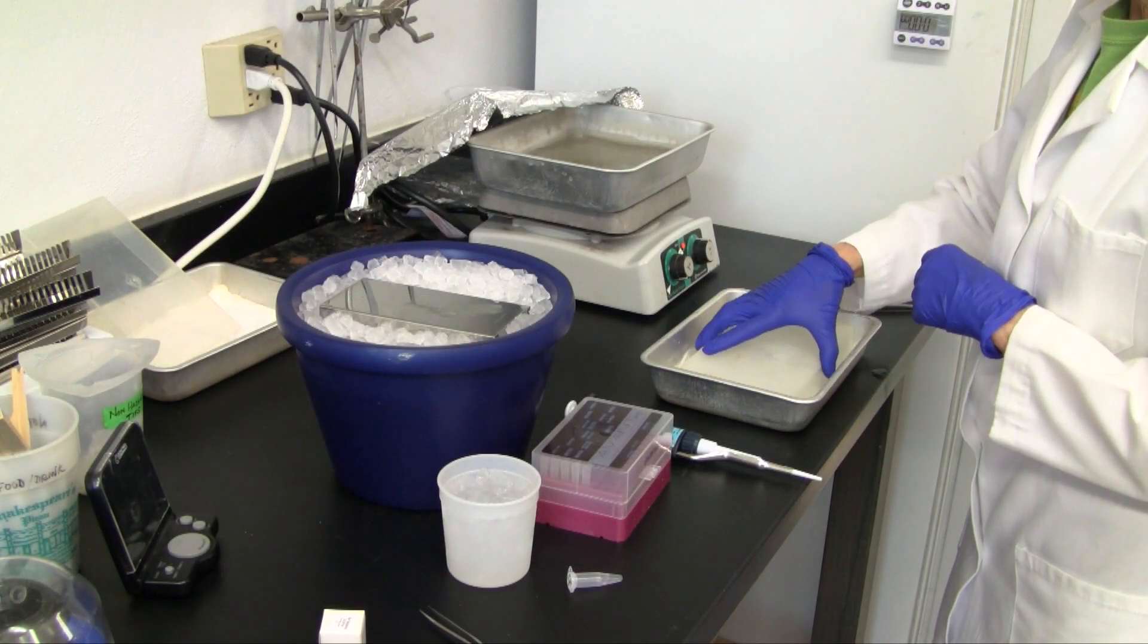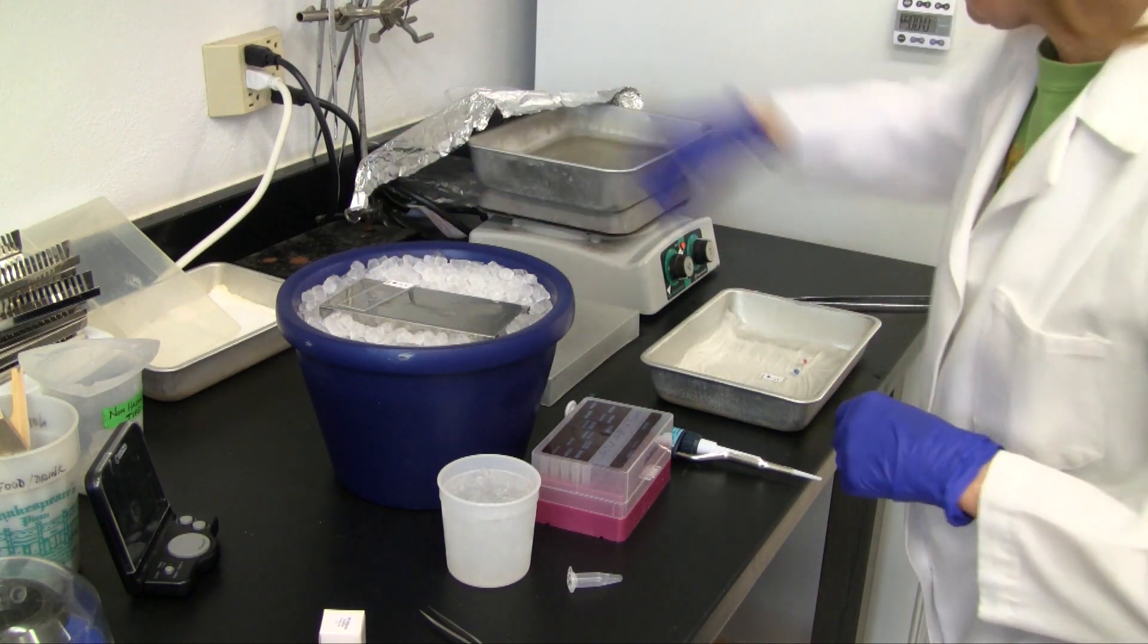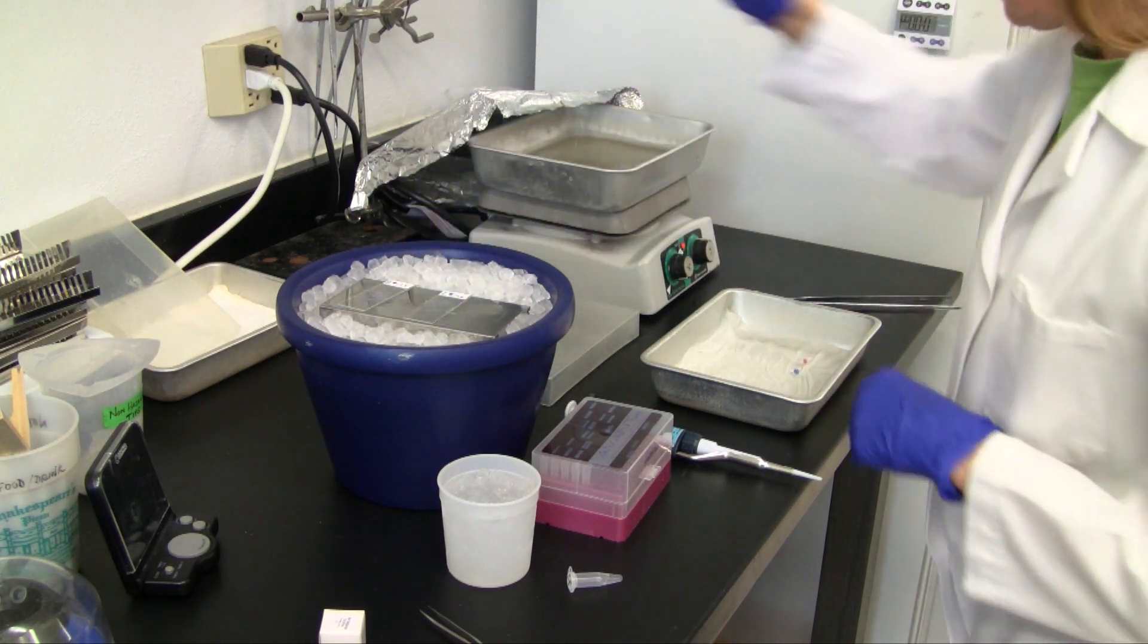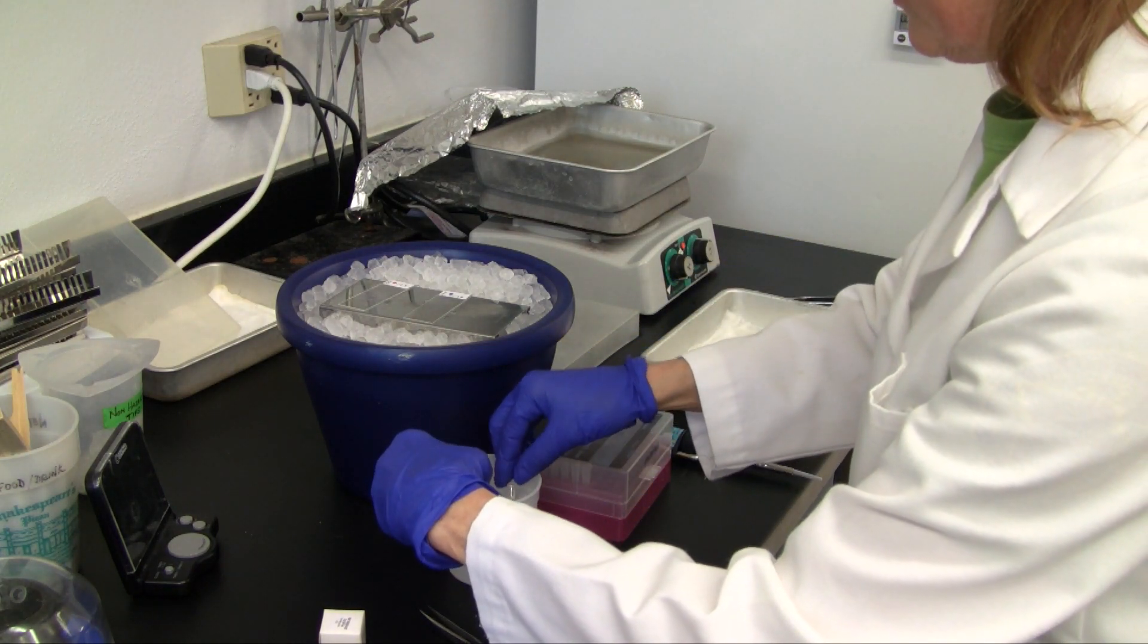After five minutes, the slides are transferred to a pre-chilled metal tray set on ice, and the probe tubes are set in an ice bath. Cold temperature prevents the DNA strands from re-annealing.